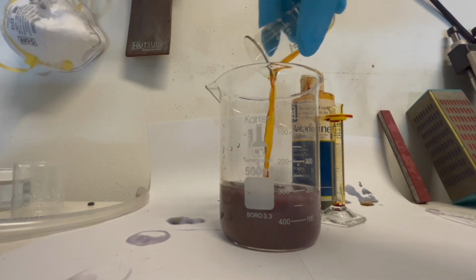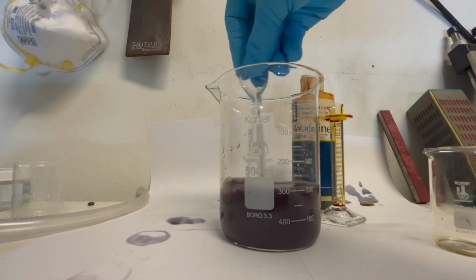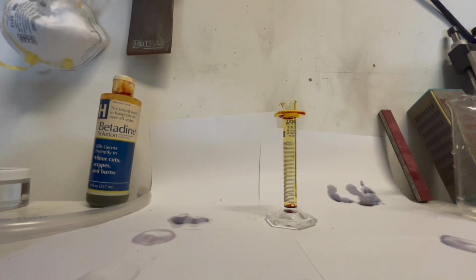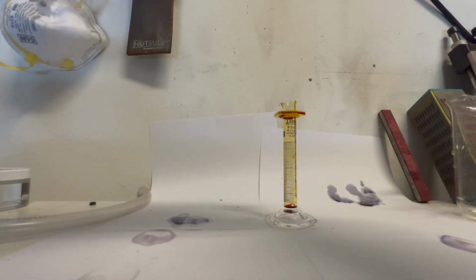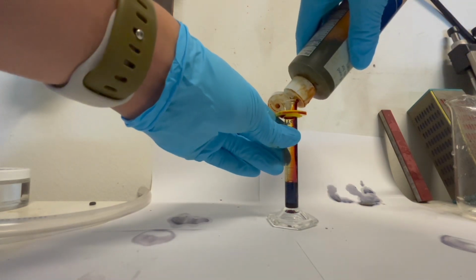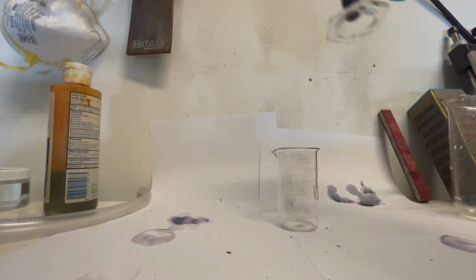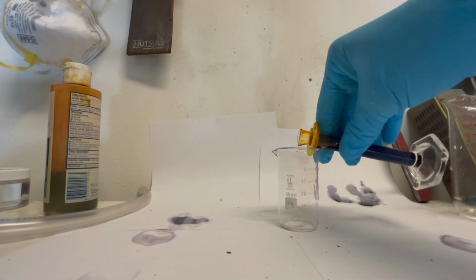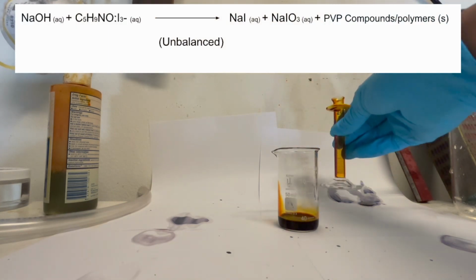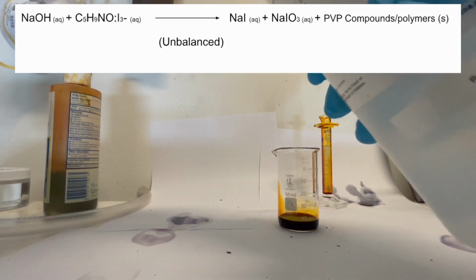I pour the rest of the iodine solution in the starch beaker, and I begin preparing the second demonstration, the preparation of the triiodide ion. This is originally made by combining potassium iodide with solid iodine or elemental iodine. But here I'm just going to show a demonstration where I split apart the povidone iodine constituents and build up from the bottom. First, I measure out about 5 milliliters of povidone iodine solution and pour it into the 50 milliliter beaker. I then add some 1 molar sodium hydroxide until an orange-yellowish color is obtained.